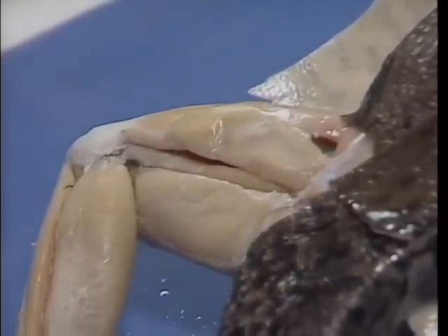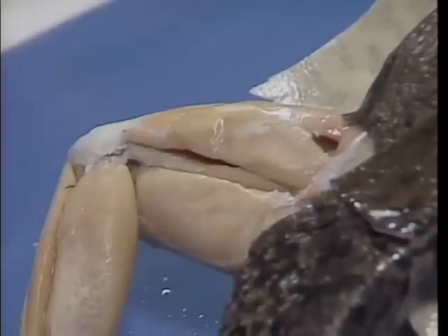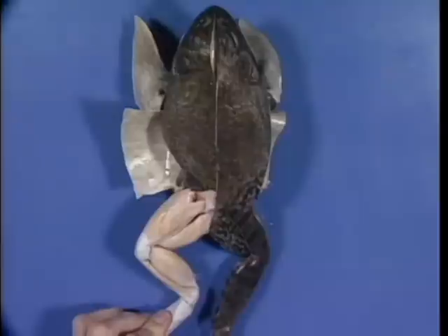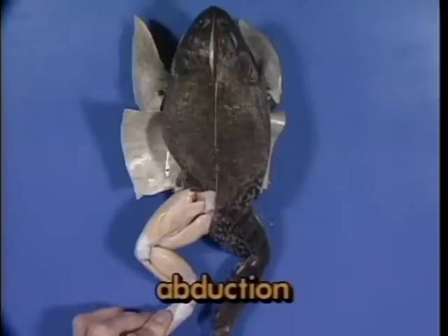These two muscles work somewhat antagonistically to each other to move the thigh in two different directions. The semimembranosus adducts the thigh, moving it toward the midventral center line, while the iliofibularis moves the thigh away from the midline of the body. Remember, this last movement is known as abduction, the opposite of adduction.